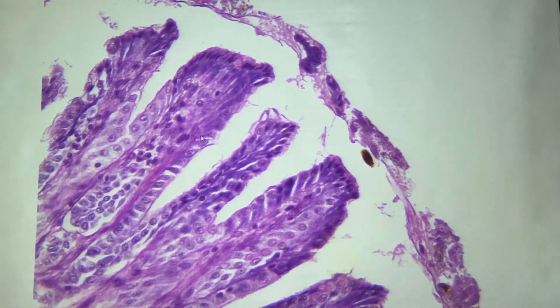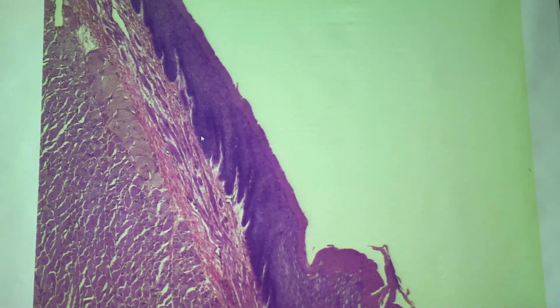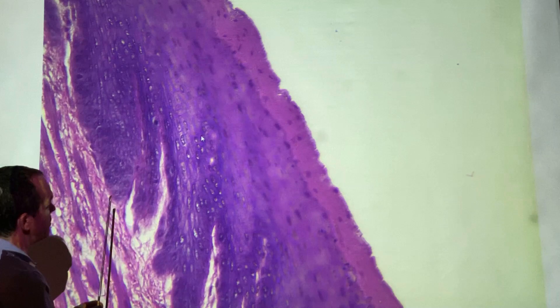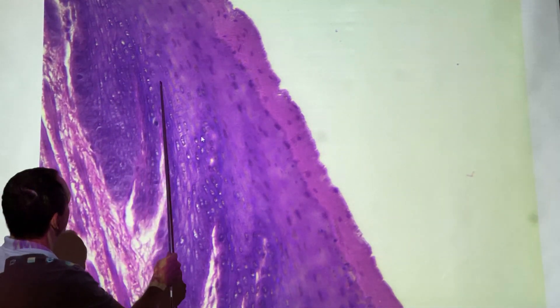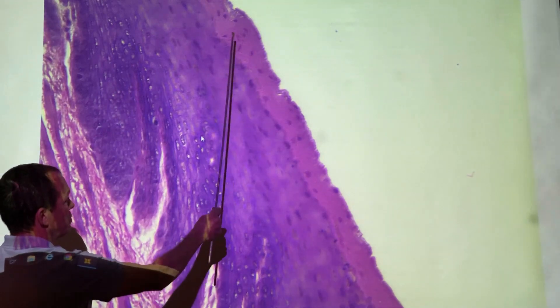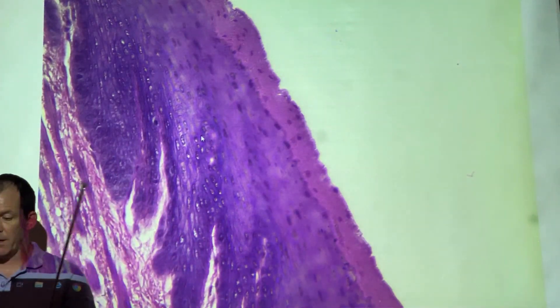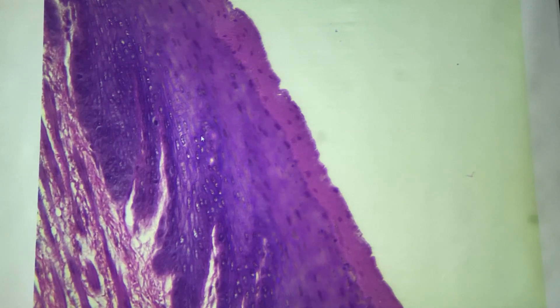Let's zoom back out to the stratified squamous epithelium and go to lower power. Zooming in on it—it's kind of smooshed, like it got smeared a little bit in preservation—but this is many layers of cells forming an epithelial surface, with free space over here. This whole region is epithelium, and it looks very different from the simple columnar of the stomach.